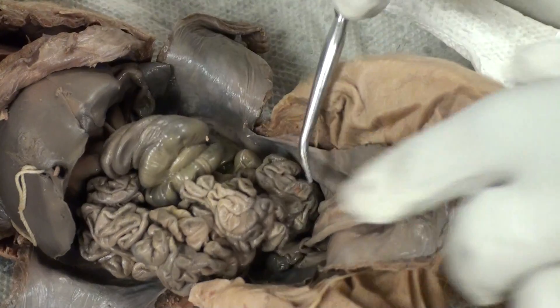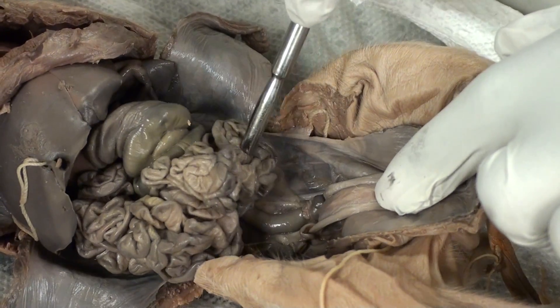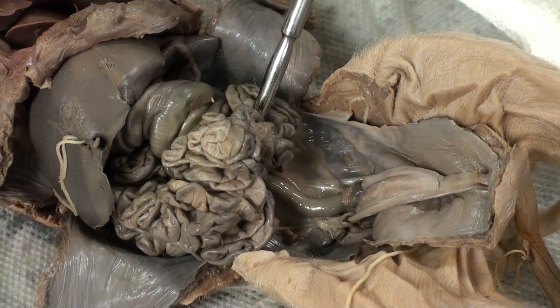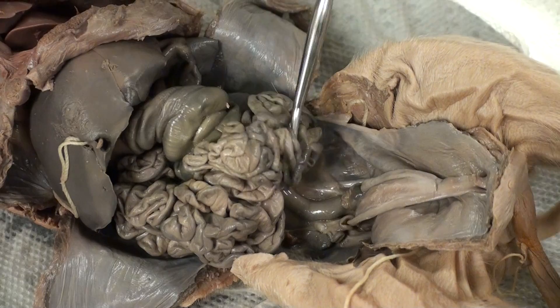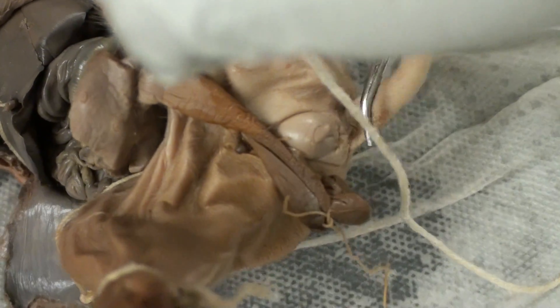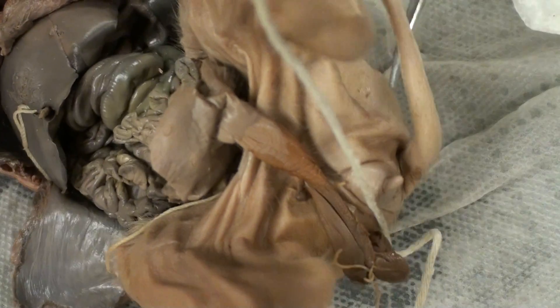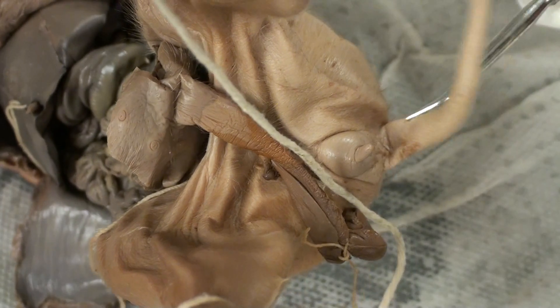Located beneath the small intestine is the rectum. Located beneath the tail of the pig is the anus, which is right over here.